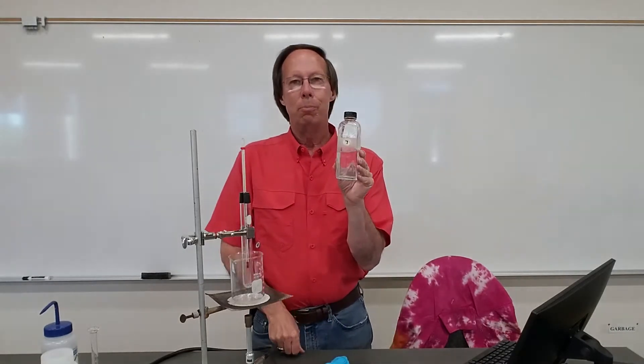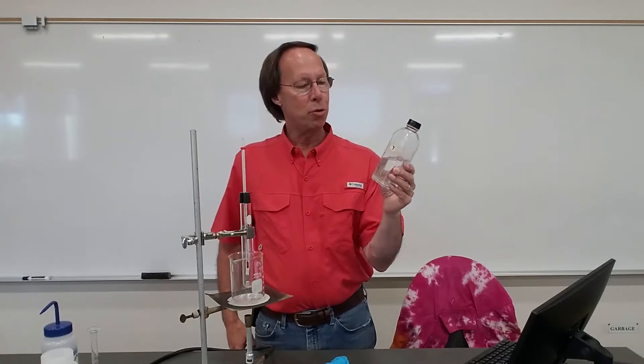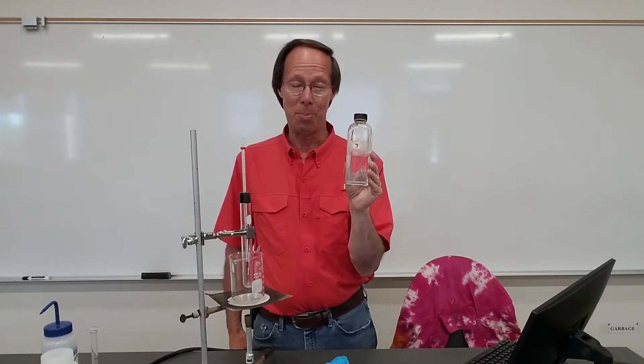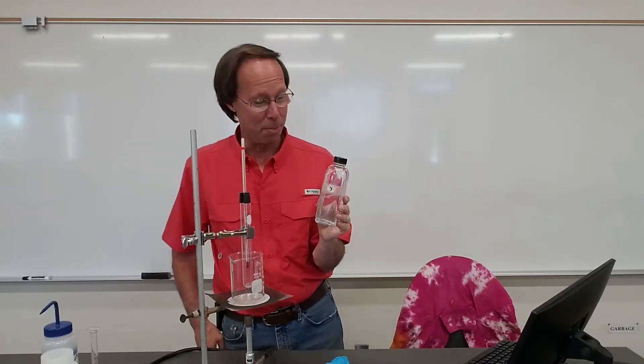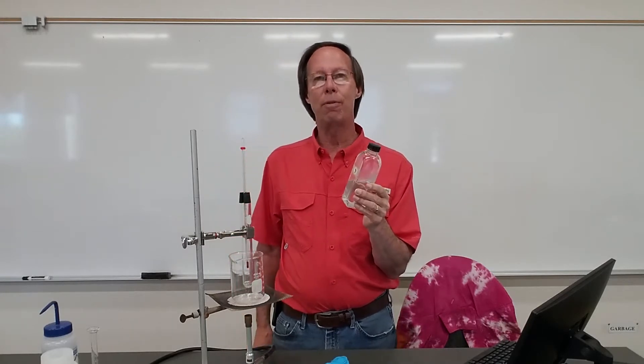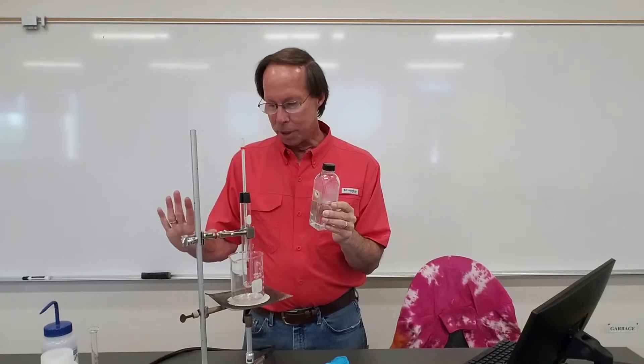We have a bunch of these various unknowns. They all look the same — they basically look like water — but please don't taste them because that would be very bad. Most of them are similar to gasoline. They're not extremely hazardous, but they are very flammable, which is why I'm going to be moving my equipment into the hood when we begin the experiment.